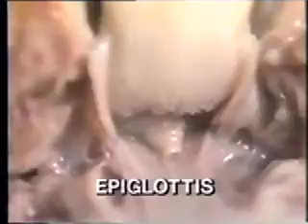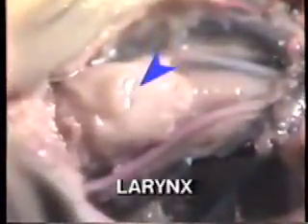The glottis is covered by the epiglottis, a flap of tissue that keeps food and other foreign particles out of the trachea. After air passes the epiglottis, it enters the larynx, a hard, enlarged region of the trachea found in the neck region. Inside the larynx are fibrous vocal cords that can vibrate when air passes over them to produce sound.